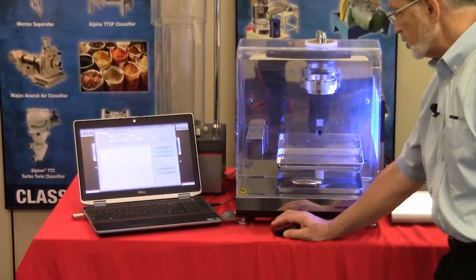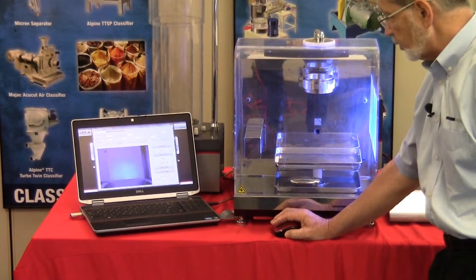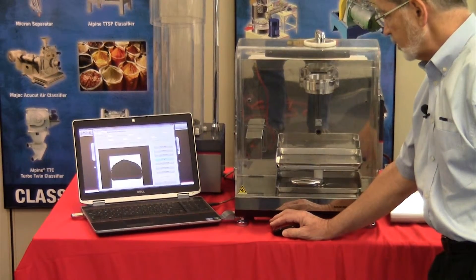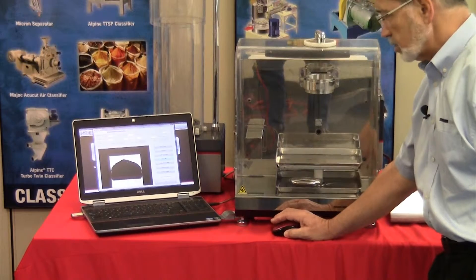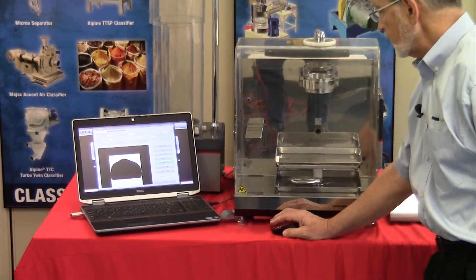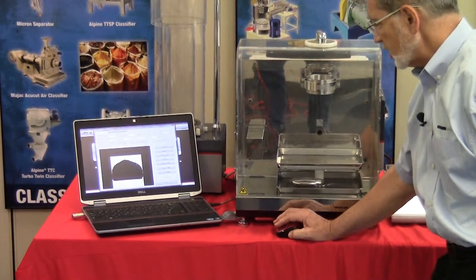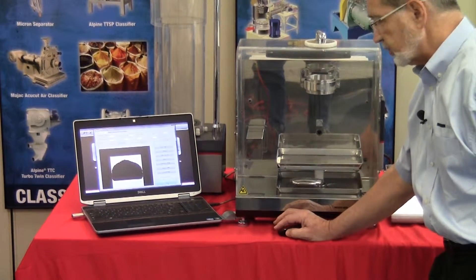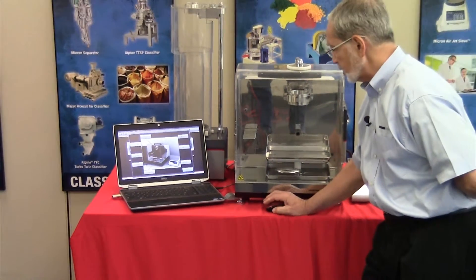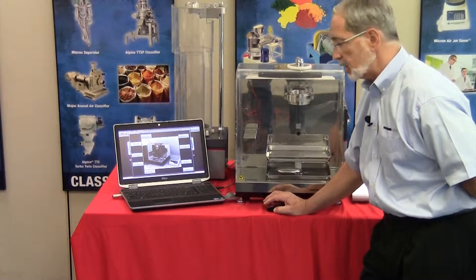We can turn the backlight on — as you can see the blue light. We can then capture a picture once everything has been determined to be in the proper focal field. We can then take the picture, binarize it. Of course there's nothing there so we're not going to get a true angle here. Then we calculate the angle to determine what's taking place. We don't have the instruments set up here but that'll be covered in the actual setup video.